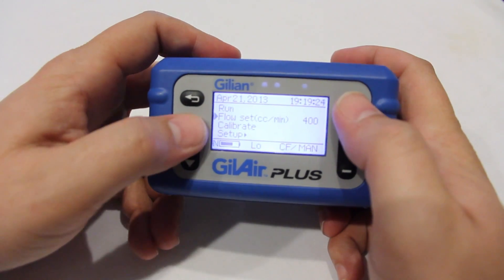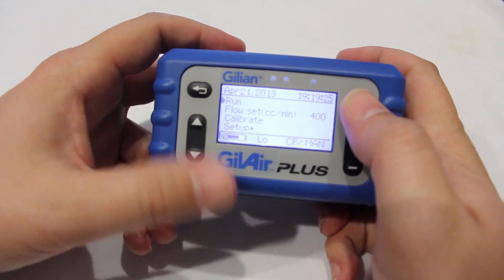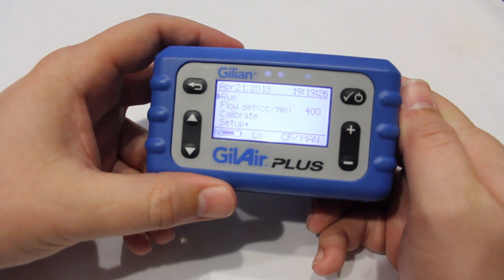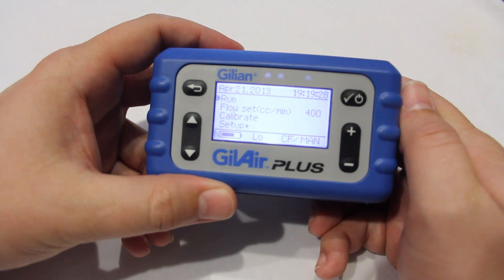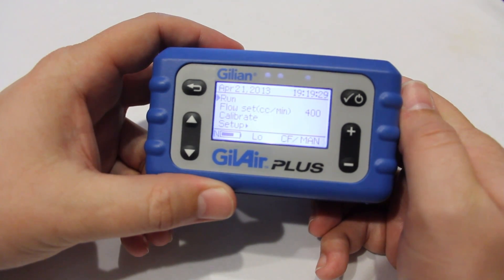Once an appropriate flow rate is set, scroll to run and press enter to begin your sample.